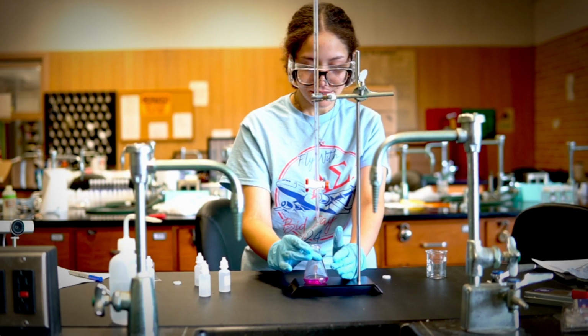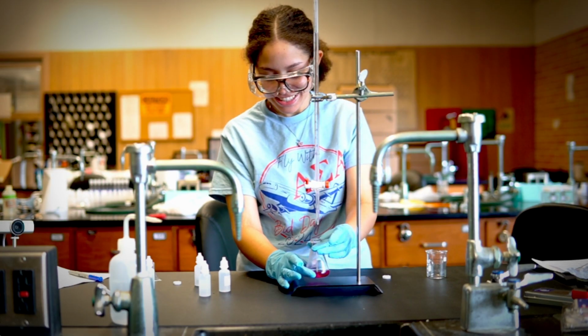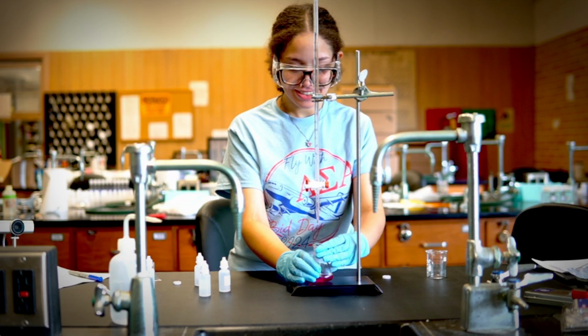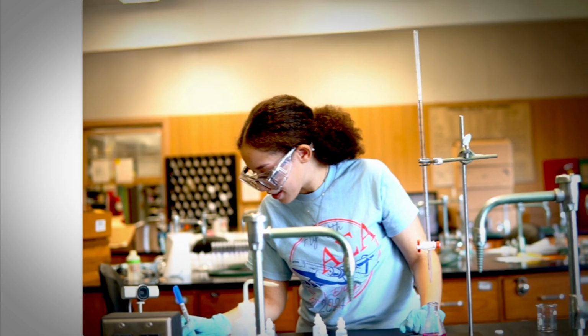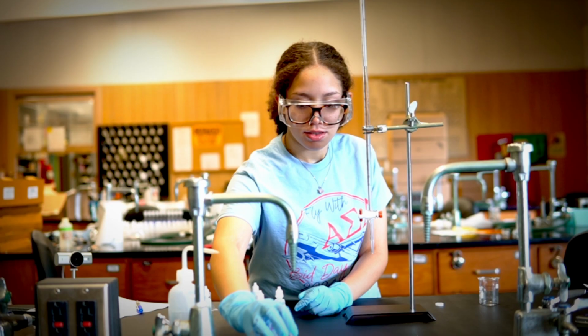So that's right there where we get to a color change that stays, doesn't go away. And that color change right there indicates our equivalence point. But the color change right there is too pink. And too pink means that we have surpassed our equivalence point. So we need to record our volume, the volume that we have added, so that we get a rough idea of where the color starts to change, so that next time we're going to be more careful when we get there. So we're going to do another titration after we have recorded the start and the end of our titration, right? After we have recorded the start and end of our volume, we know how much we've added, so we're going to do it again.